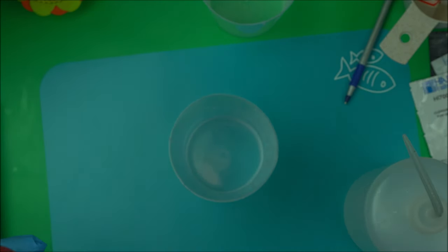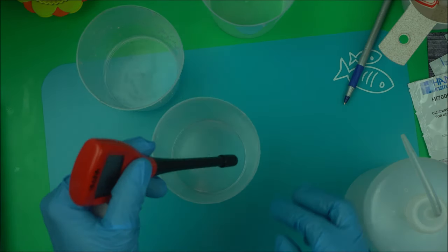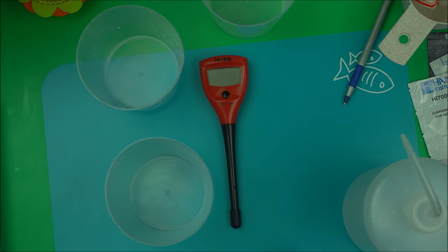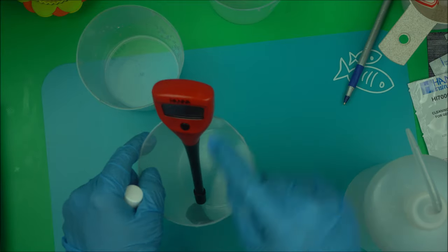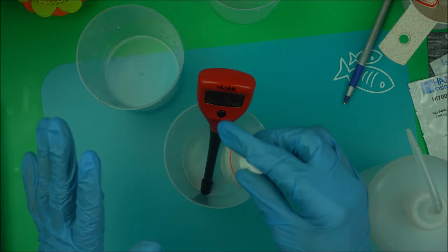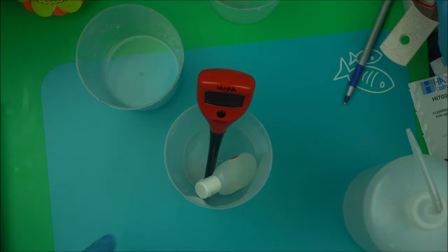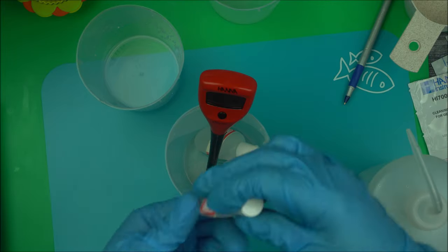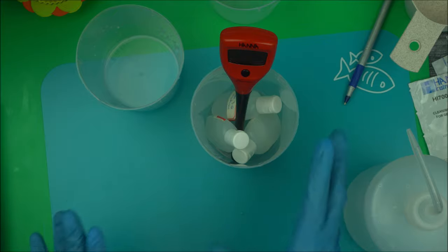When storing, make sure you store it upright — do not store it on its side, that is the wrong way. Always get a dedicated cup for your pH meter and store it standing upright like this. I also put my cleaning solution and both buffer solutions — 7.0 and 4.0 — in the same place, so everything is together and dedicated to the pH meter.